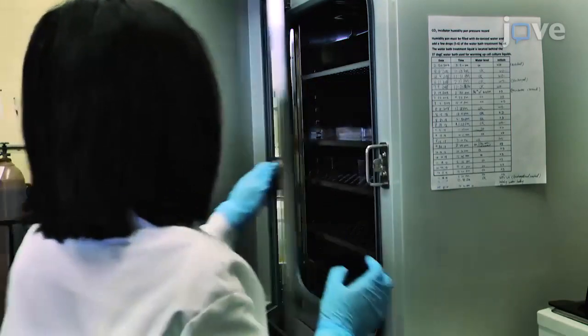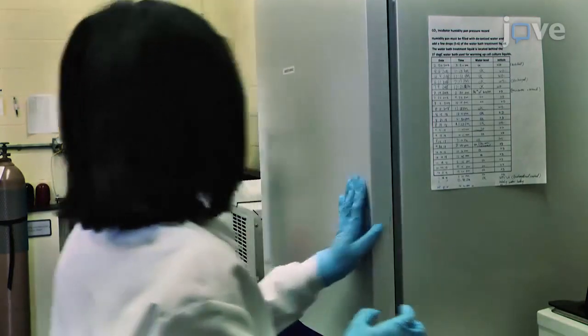Incubate the plate for 7 days to allow the cells to reach 100% confluency.